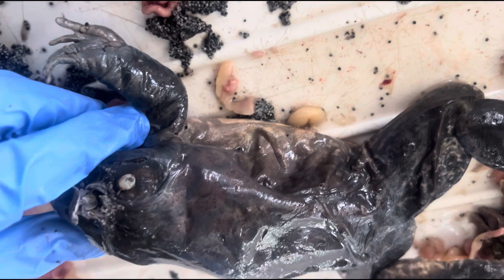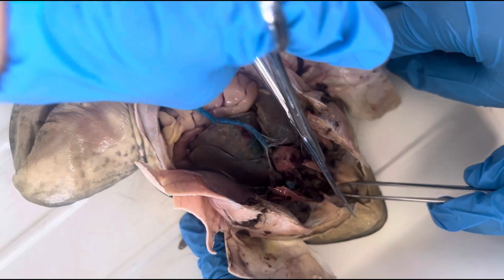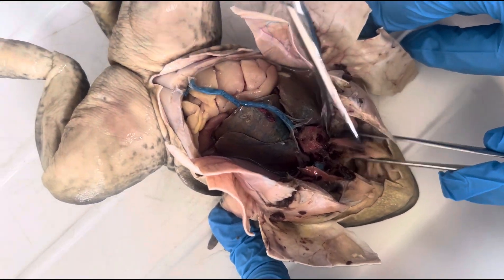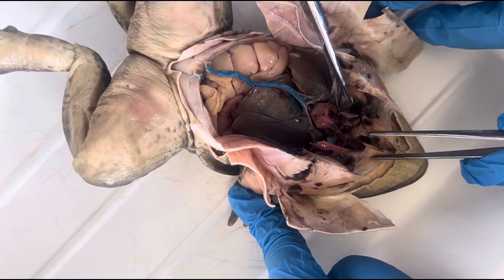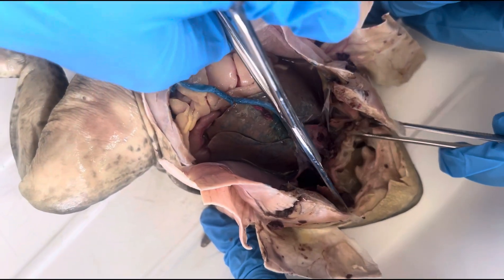Now cut his mouth out as well if you can and see if you can find his tongue. Okay, sit down. Yeah, start taking everything apart now — take all the intestines out.